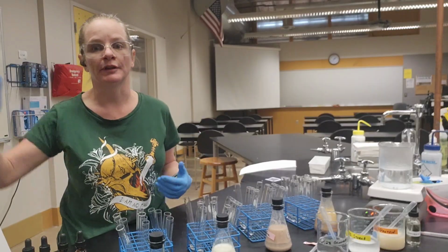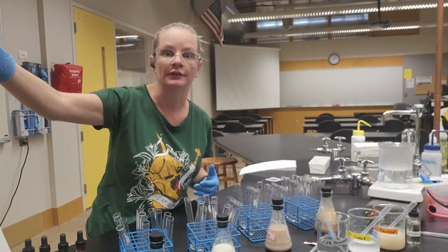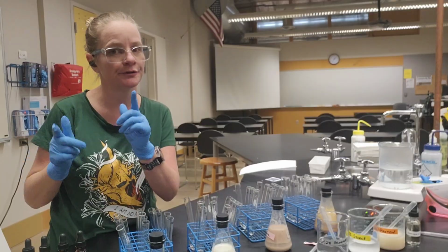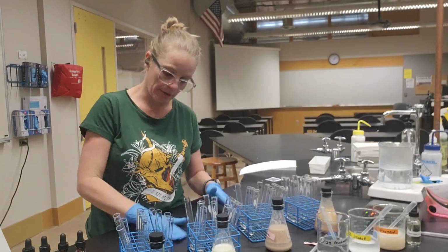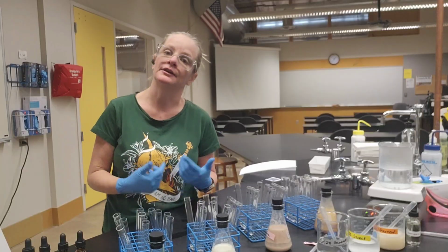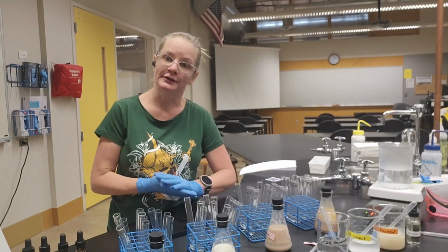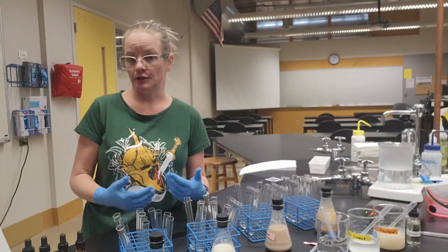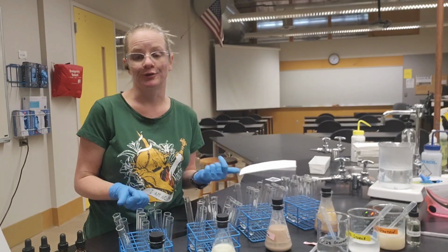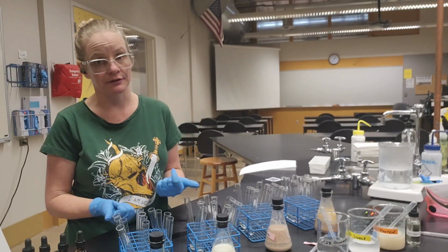Might have been you, but let's blame the prep team because that's what I like to do. Okay. Or the data. Blaming the data is a good one too. Okay. So anyway, if we get a positive result in the negative control, we know that we need to try that negative control again, maybe run the whole entire test again so that we're making sure that our results are valid. The positive controls, however, are a little bit different, right?